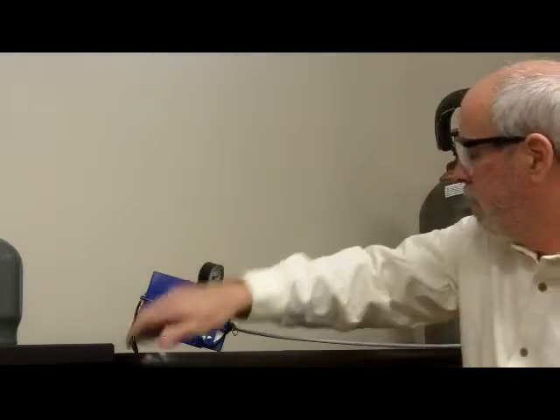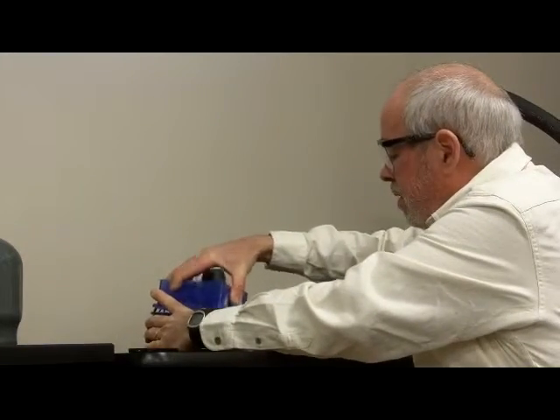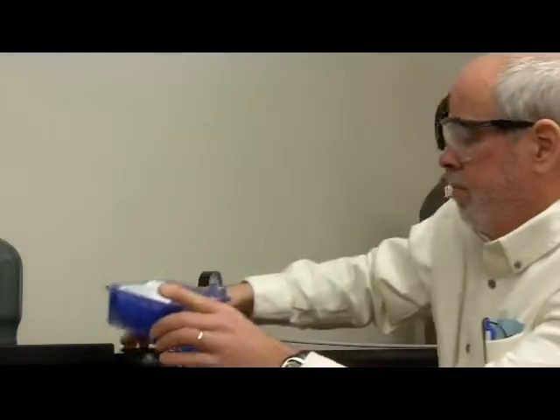Hopefully that will be enough for my purposes today. I just have to take apart this blue chamber, and it's a little difficult to see, but very small quantities of dry ice have set in at the ends, and if I go long enough, I can fill this whole chamber with dry ice. Often I only need just this small quantity that I have in this chamber.